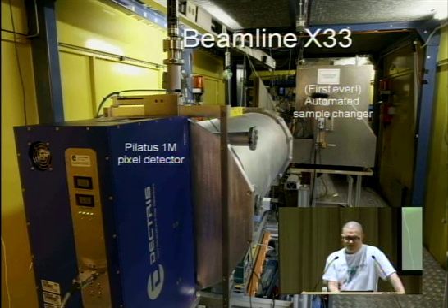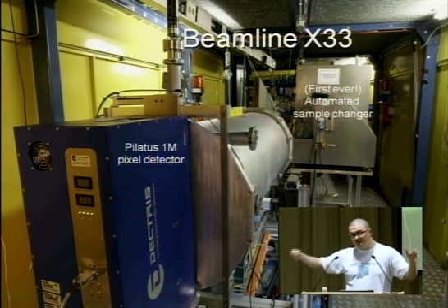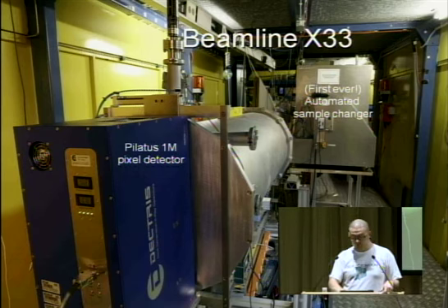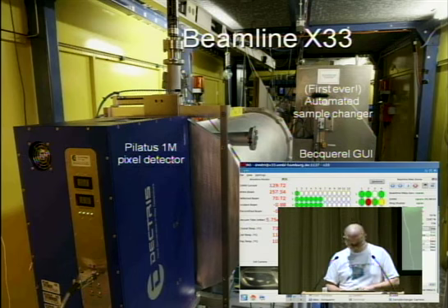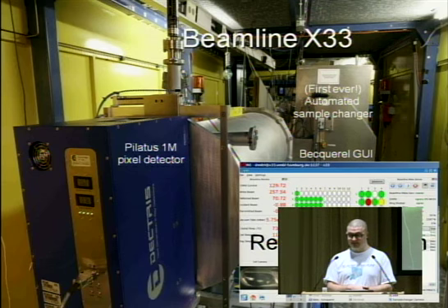And besides, we created software that would control all this hardware. So we could just say measure, and the software would control the sample changer, load our sample, make sure that the sample is loaded, and then it would control the detector and start the data collection. On top of that, we had a user-friendly graphical user interface that would permit the user to enter all the data and to observe the measurement process.